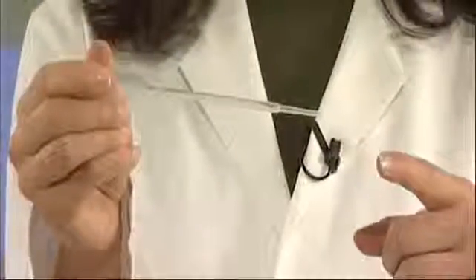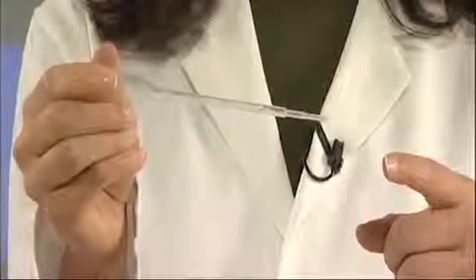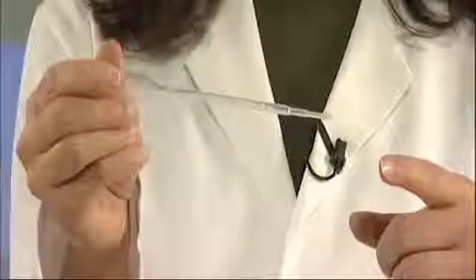Avoid touching the tip. This is important. Contamination at any stage could ruin the experiment.